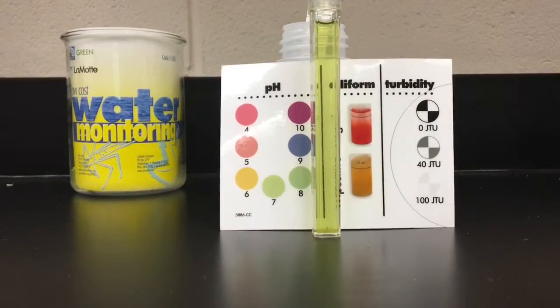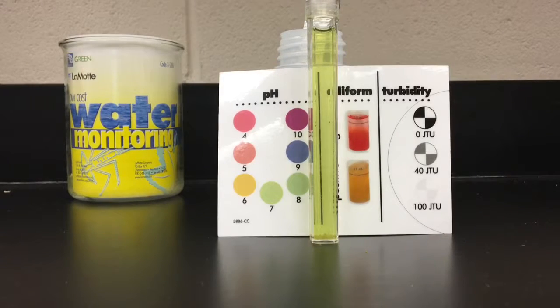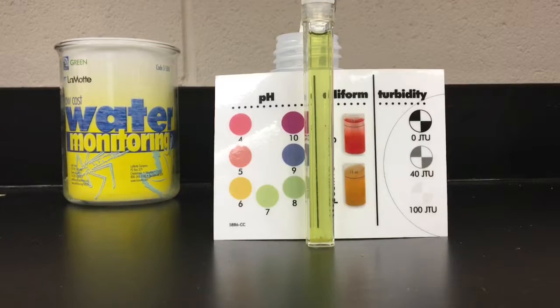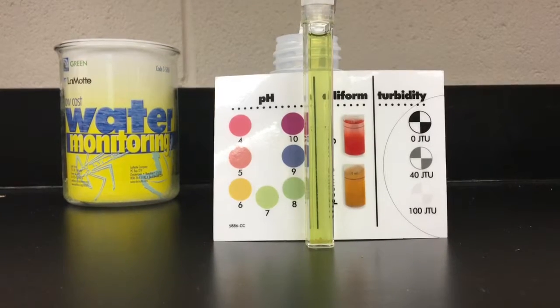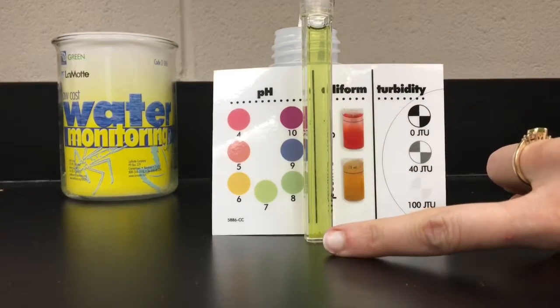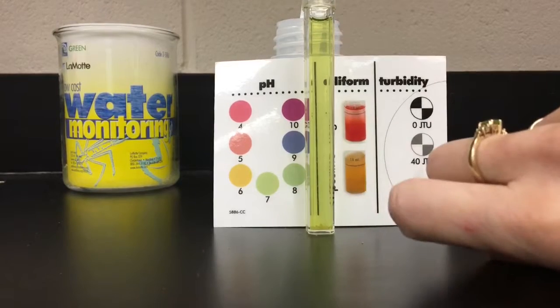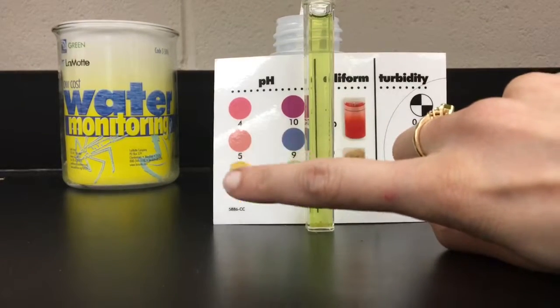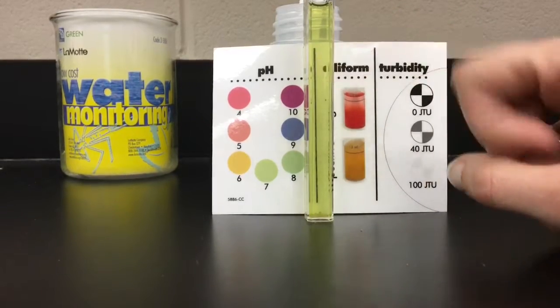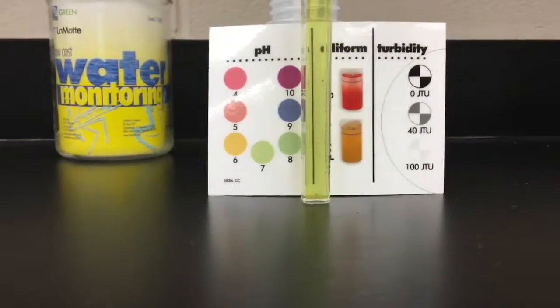Another test we did is for pH. pH is a measurement of the acidic or basic quality of water. Most organisms are adapted to life at a certain pH, and even slight changes up or down can result in death. When we look at our sample we can see it's a nice bright color, so it's between a 7 and 8 — we would call this a 7 and a half. Fresh water likes to keep it between 7 and 8.